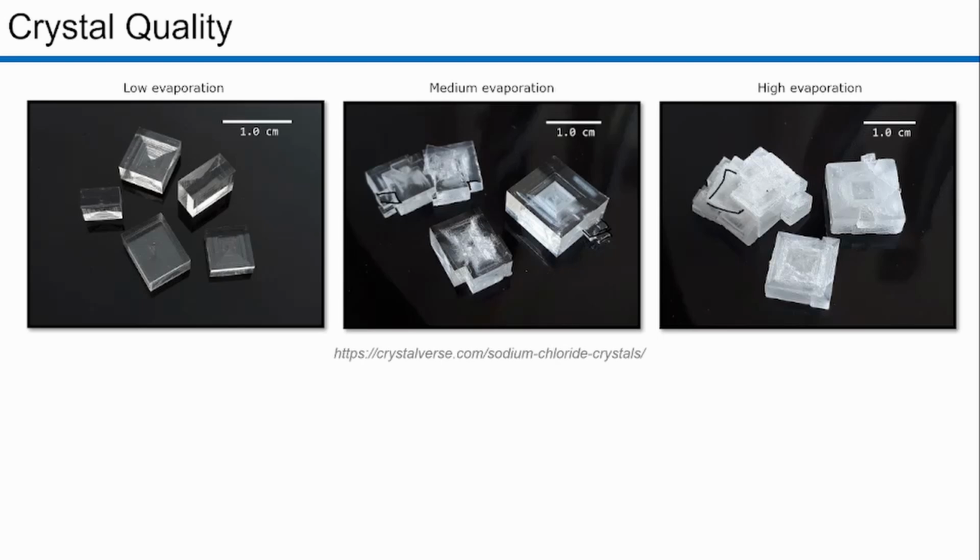meaning that there should be an alignment in this direction, but this one grew in this direction, and then this one got another direction, and so forth, and they are very opaque. You see, the faster the evaporation, the whiter the crystal gets. This is probably because the lattice is not aligned, so light scatters on the lattice.